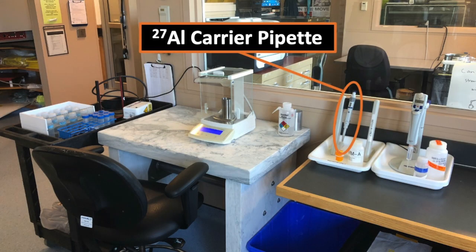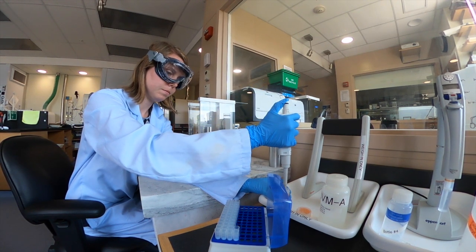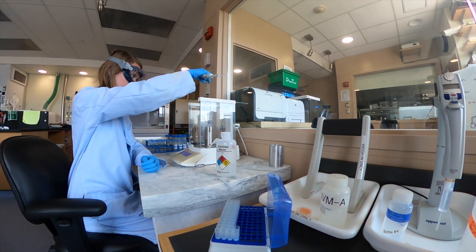This is the aluminum-27 carrier pipette. It's a variable pipette, so we can make a calculation of how much aluminum carrier we need to add to get to a total of about 2,000 micrograms of aluminum in each sample. That gives us plenty to prepare at least 1 and sometimes 2 cathodes from each sample for measurement on the AMS.